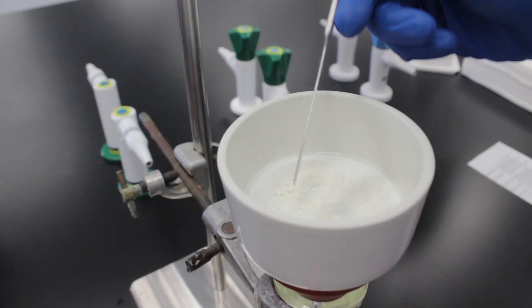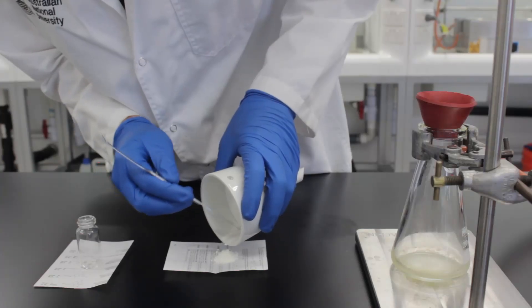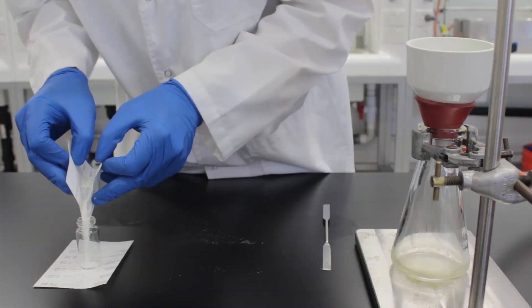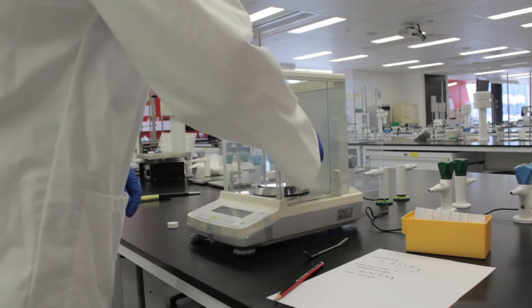The crystals are dry when they stop sticking to the spatula. Carefully collect your crystals in a pre-weighed vial, making sure you scrape the filter paper, and record the mass and yield.